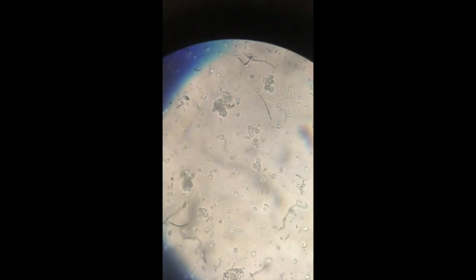This is yeast at 100x. It's very small — so small you really can't even see what the yeast are until I go to 450x. So let's go to 450x. Now you can see what they look like.